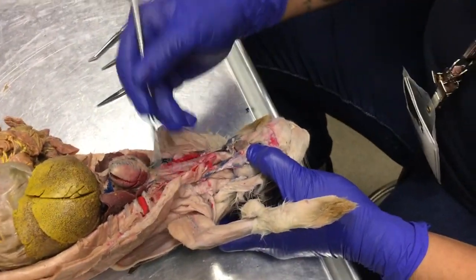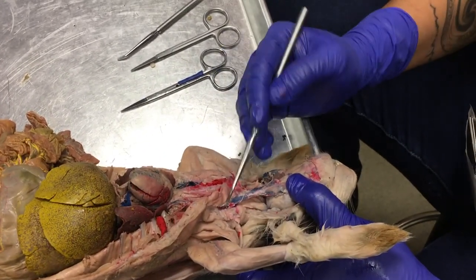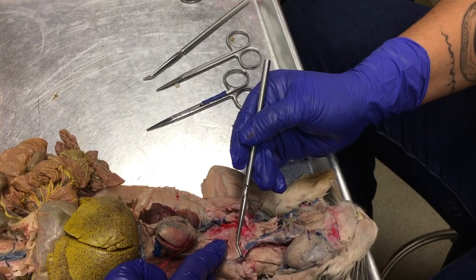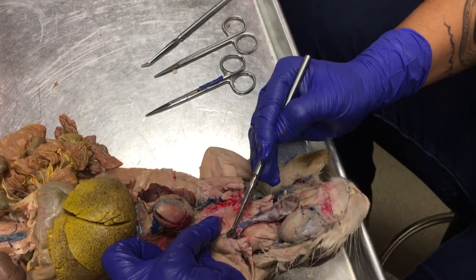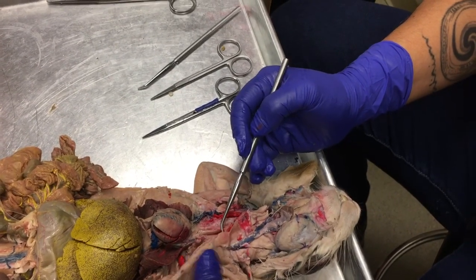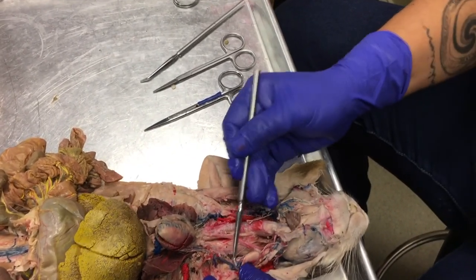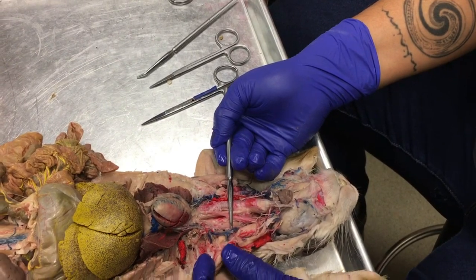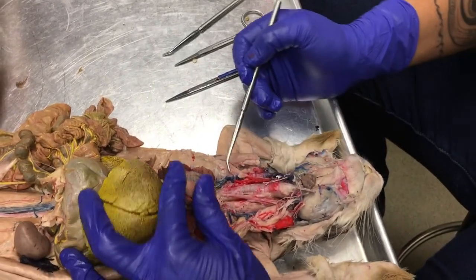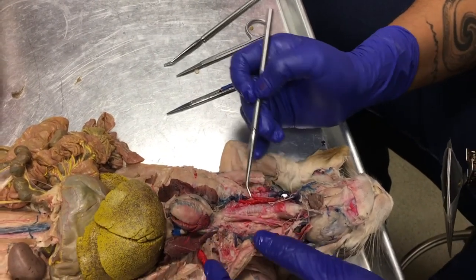Okay, so if you recall, this one's a little better. If you recall, this external jugular vein runs along the surface of the neck muscles and then enters the body right here at the pectoantebrachialis and clavodeltoid area. Okay, so see, look at that big jugular vein. It's crazy. Okay, so right there at the pectoantebrachialis muscle, this big external jugular vein enters the body cavity. Okay, it travels down toward the heart on both sides, and then it's joined by a tiny tributary.